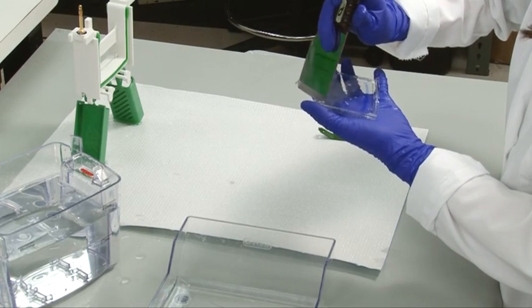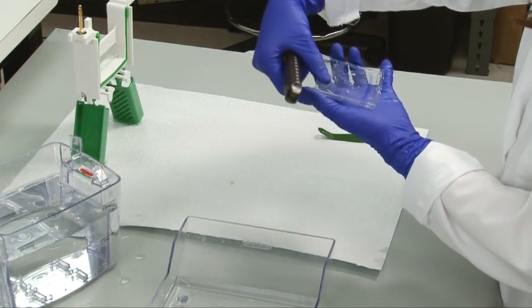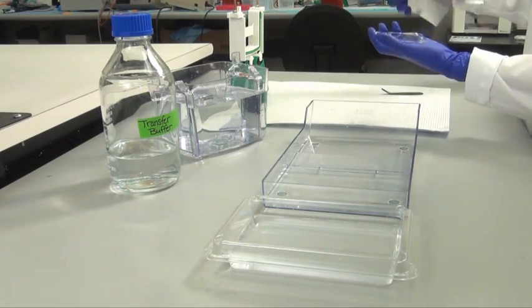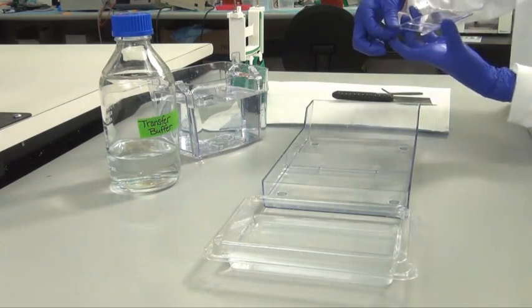Notch the top left corner to indicate gel orientation. Float the gel in transfer buffer while preparing the transfer sandwich.